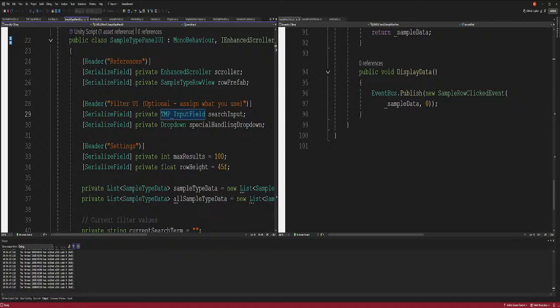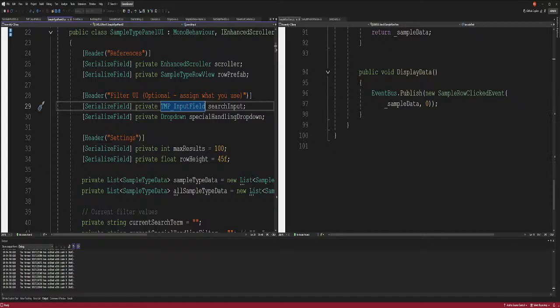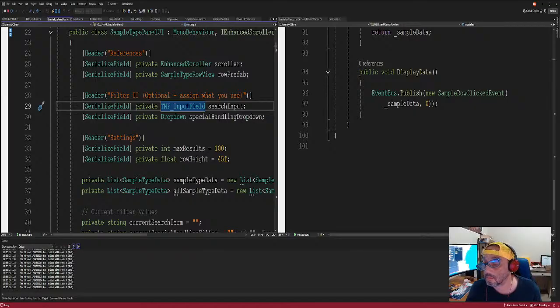Okay, let's delete this for right now. I know I'm going backwards a little bit. The chatter is correct, right? Why not reuse the sample type prefab stuff for the display? I say it may be different, but yeah, he's correct. All right, so hurry up and get this done. You're done? Okay.